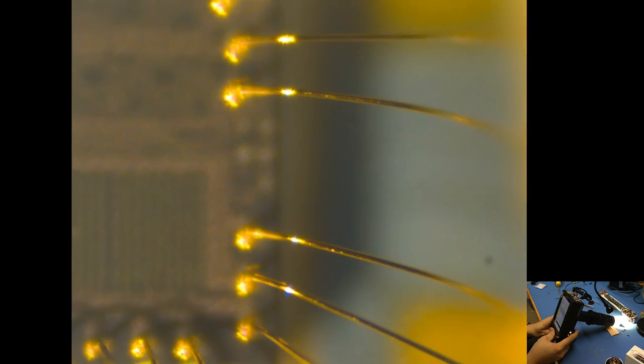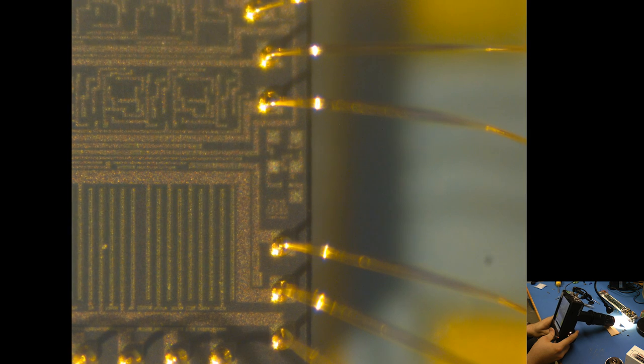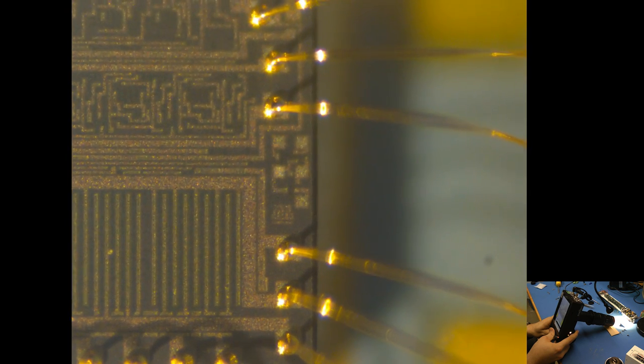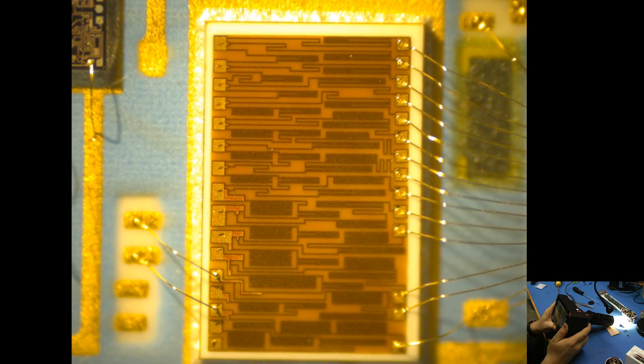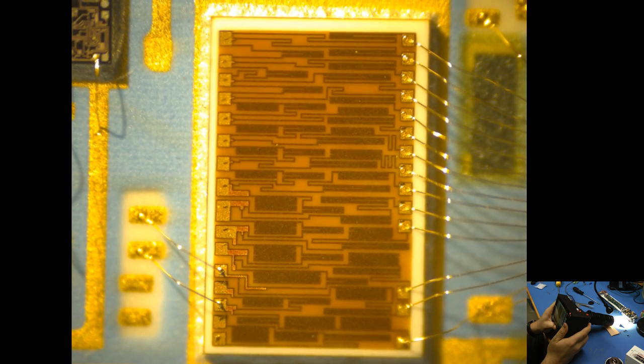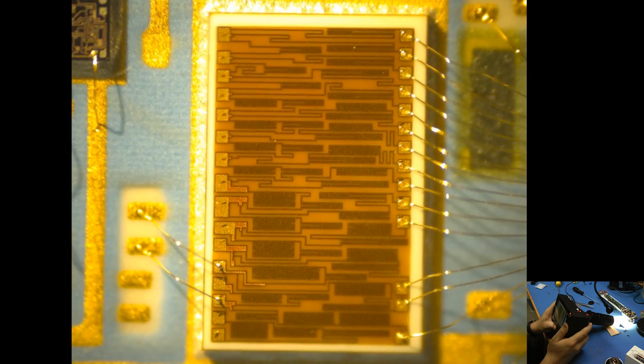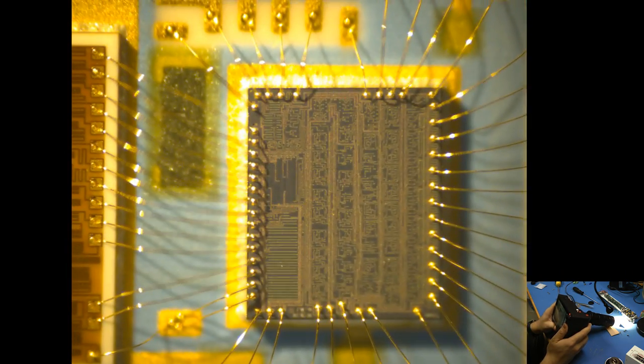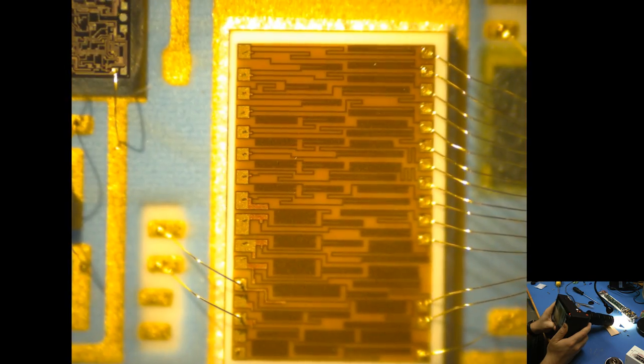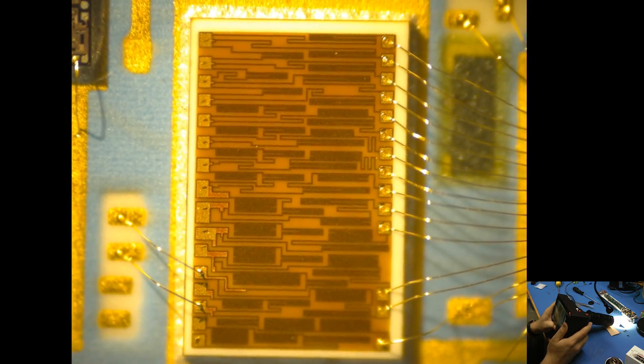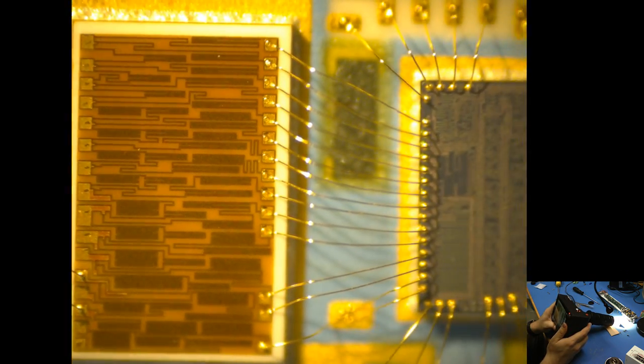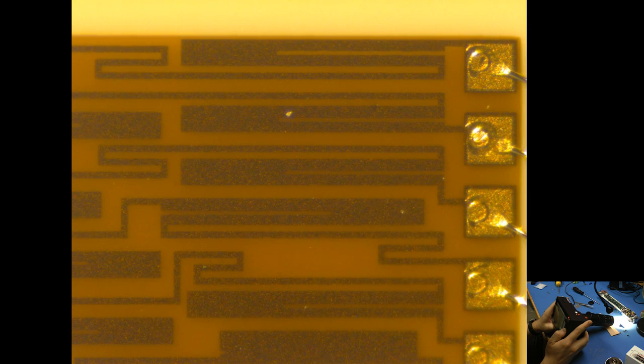Yeah, I don't see any real markings on this. Maybe there. Hmm, something, can't quite zoom, doesn't quite zoom in enough to read it unfortunately. Here's an overview of that small part with all the trimmed resistors on it. There's a lot of trimmed resistors. Like probably 30 or 40 of them on this. I can imagine this might be some sort of an R2R DAC or some sort of a DAC. Because this I do believe may send analog information over those cables. Those lines. There's digital on this side. And then appears to be more analog stuff here. So if we zoom in. Let's see if we can get some focus. Yep, you can definitely see laser trimming lines on some of these. Maybe someone want to try to reverse engineer this or draw out the schematic. Maybe that'll give us an idea of what this part actually is.